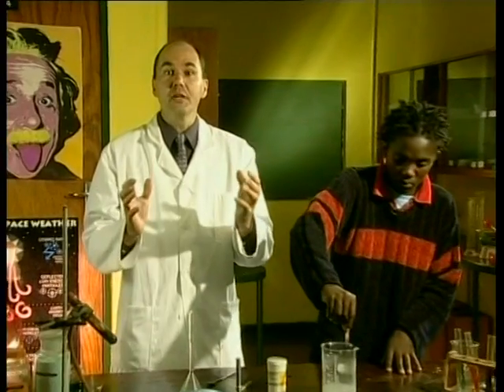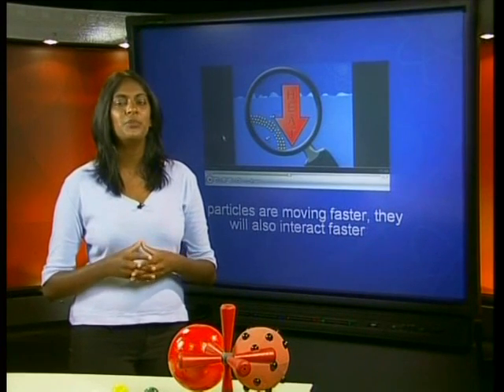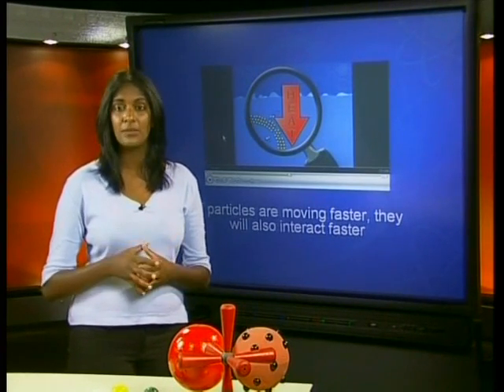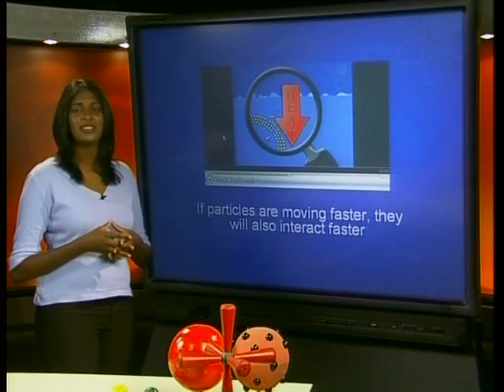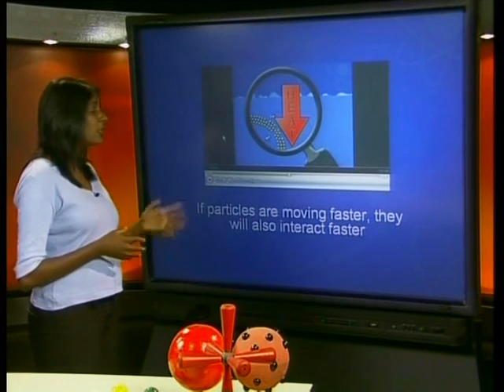As you can see, when calcium reacts with hot water, the same products are formed: calcium hydroxide and hydrogen gas. It only happened much quicker. Through this simple experiment, we have accomplished two important things. We checked that the products of a metal reacting with water at room temperature are the same as when a metal reacts with boiling water, and we proved that the conclusion from the kinetic theory is true: if particles are moving faster, they will also interact faster.